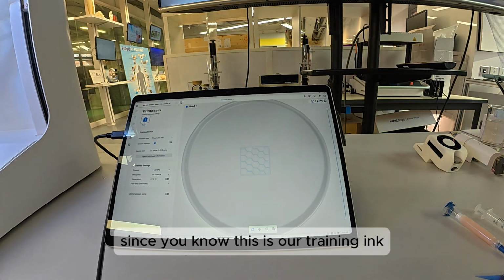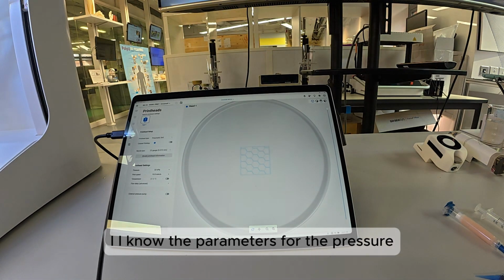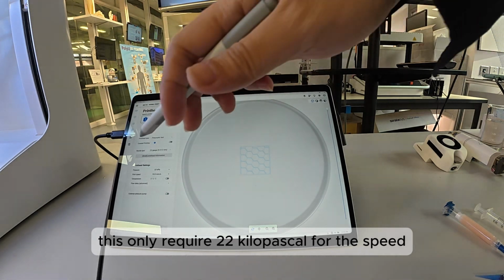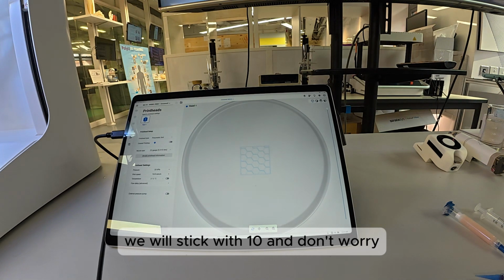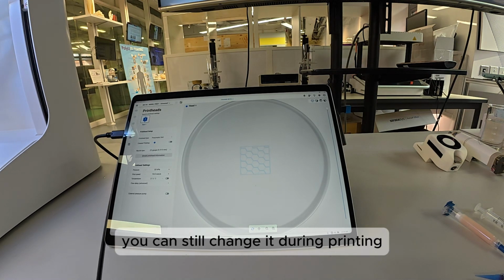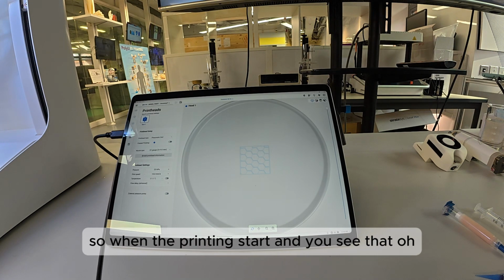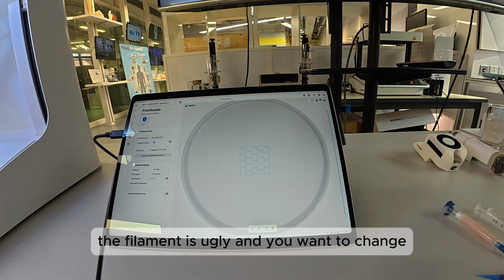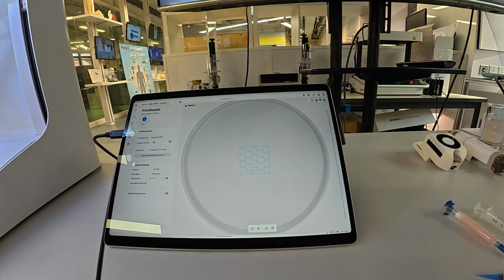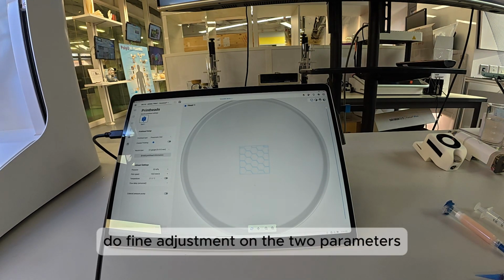And for this one, since this is our training ink, I know the parameters. For the pressure, this only requires 22 kilopascal. For the speed, we will stick with 10. And don't worry if you don't know the parameters of your material, you can still change them during printing. So when the printing starts and you see that, oh, the filament is ugly and you want to refine it, you can do it real time on the software and do fine adjustment on the two parameters.